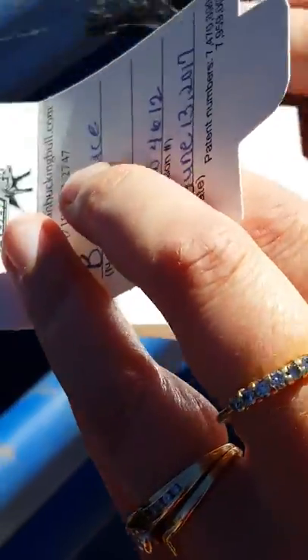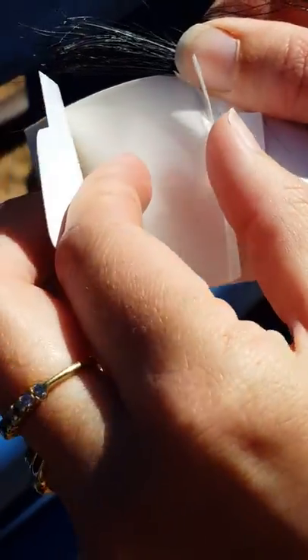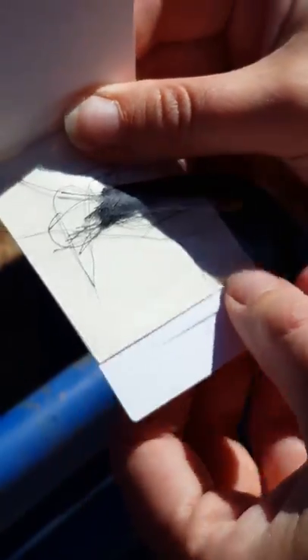So at this point, you lift up the flap, and the flap shows underneath there's a little plastic piece. You want to lift that up and put the root bulbs in between the sticky part and that plastic flap.